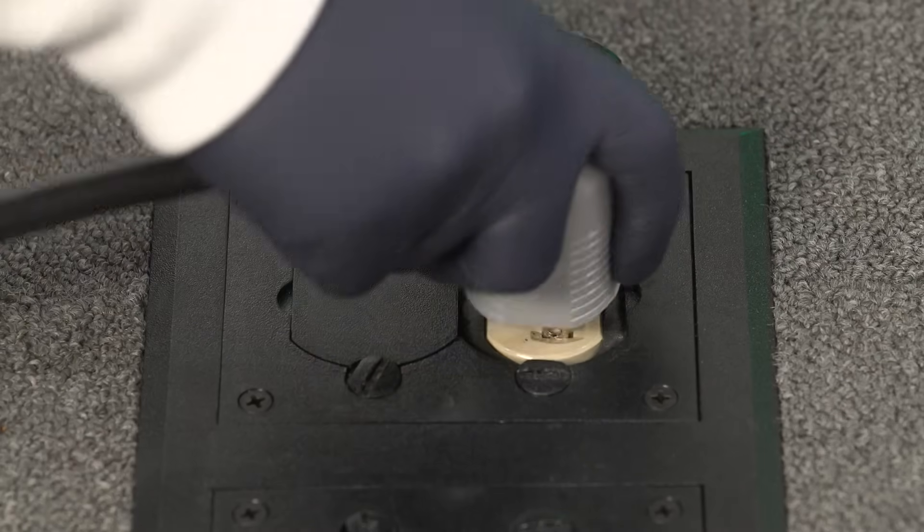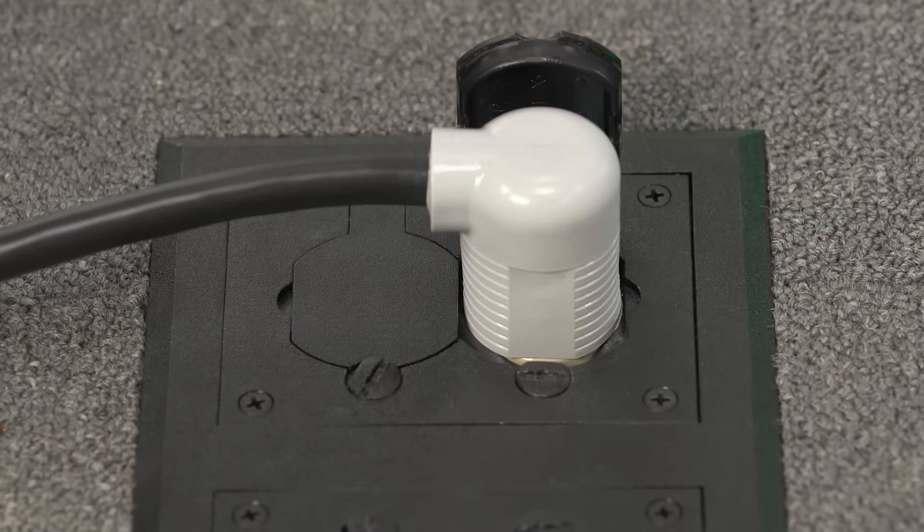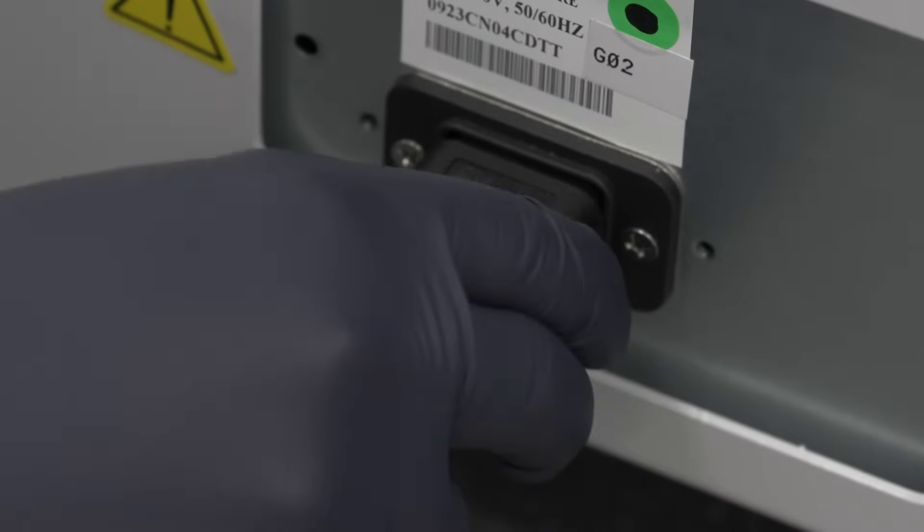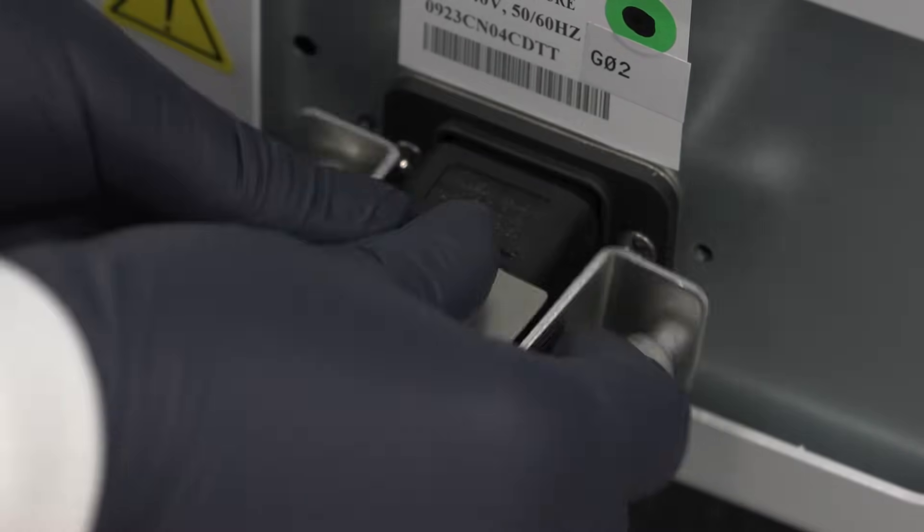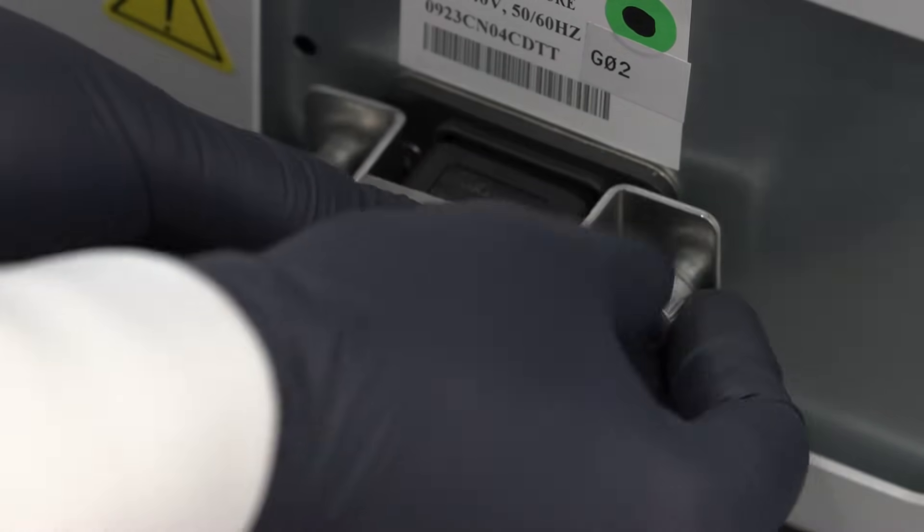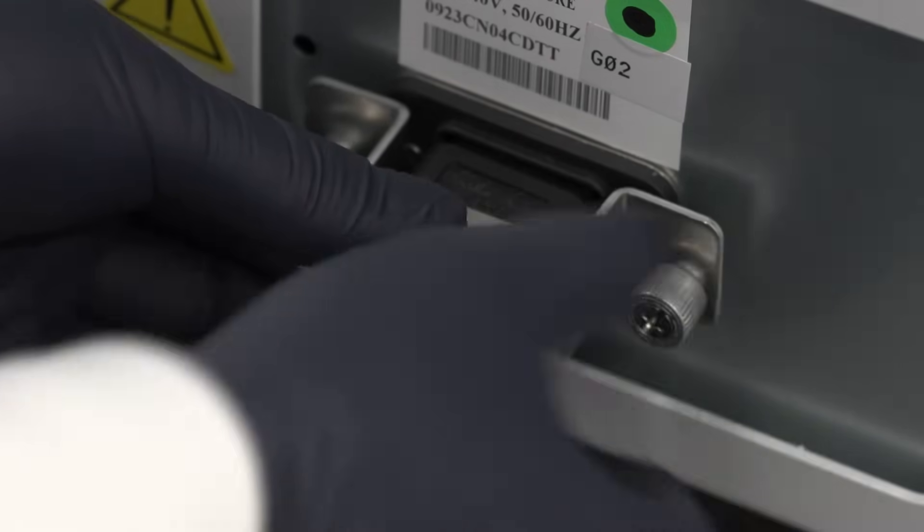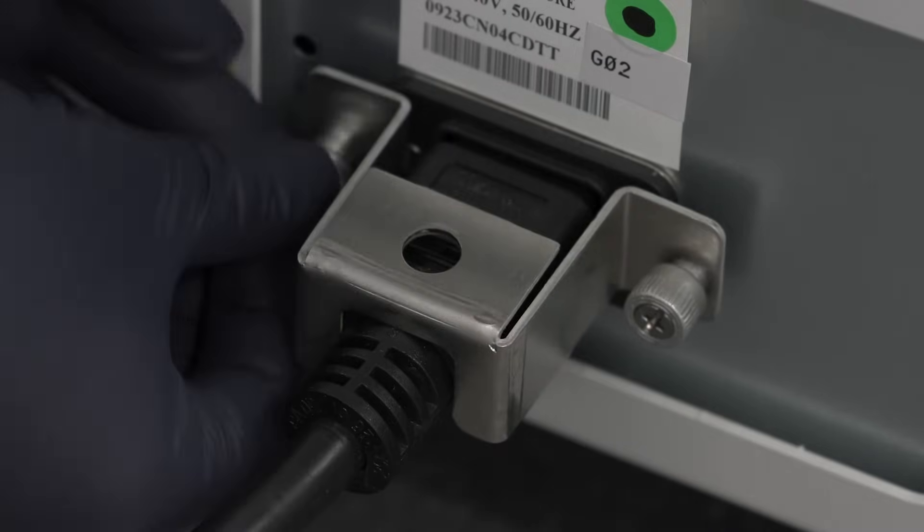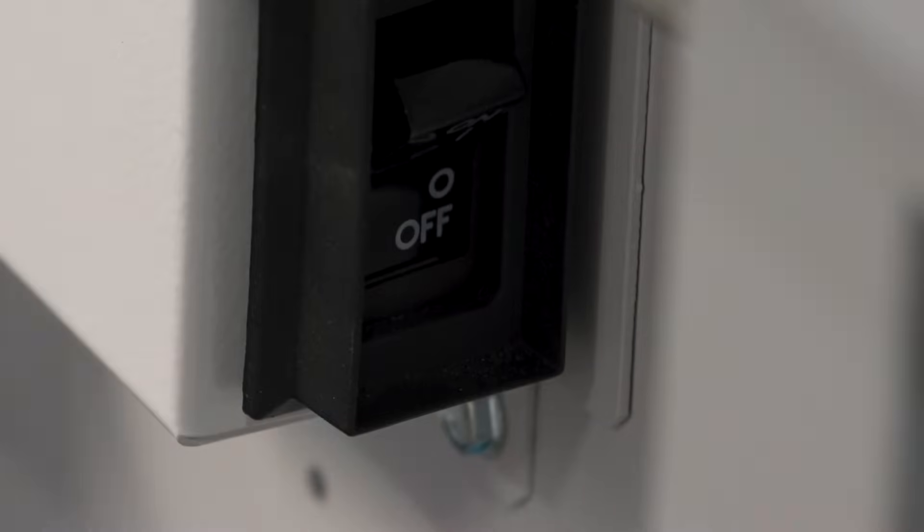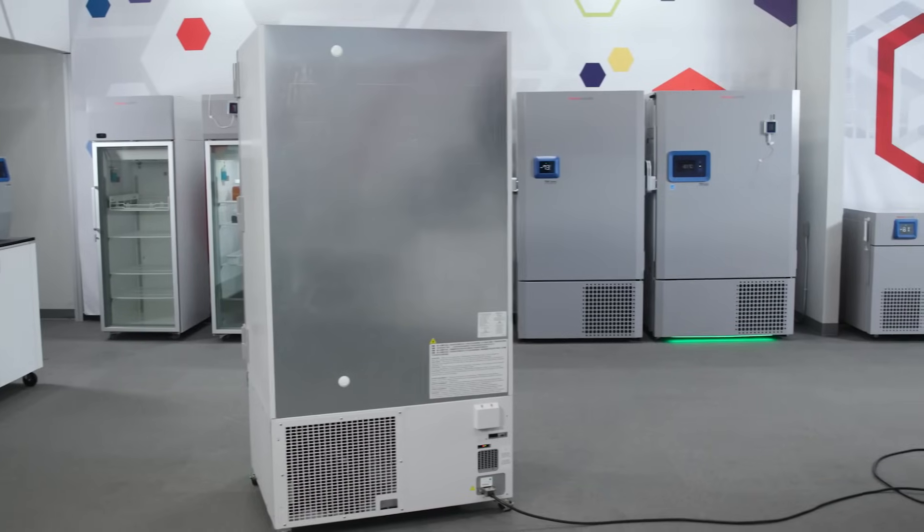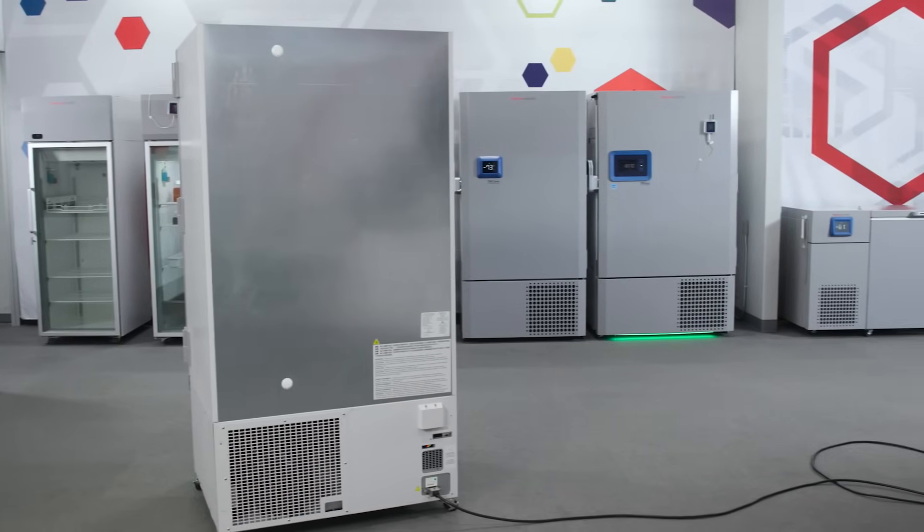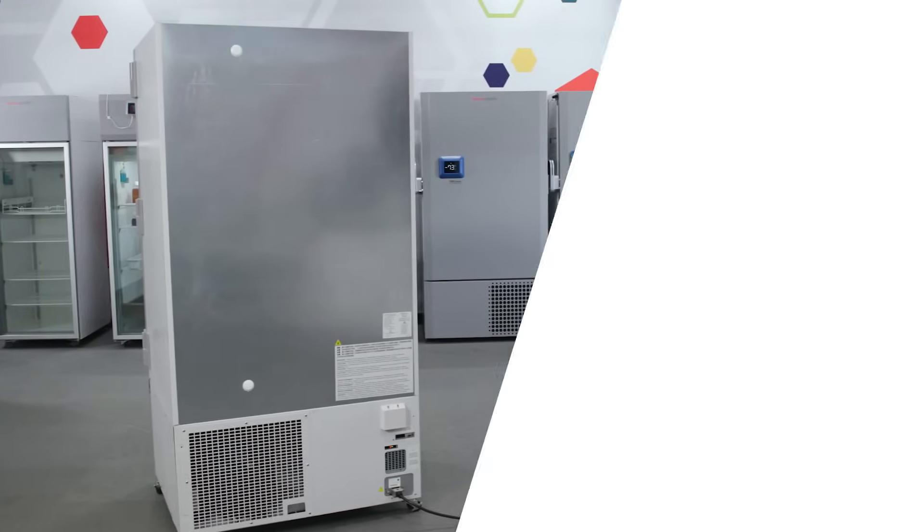Electrical requirements are another important consideration. While the TSX Universal ULT Freezer can operate on any voltage between 100 and 230 volts, a dedicated power source is important to help provide a stable voltage supply to the unit. When voltage excessively sags or spikes due to the electrical loads of other equipment, it can result in voltage being delivered to the freezer outside of its operating range.